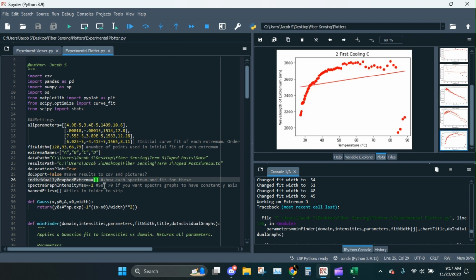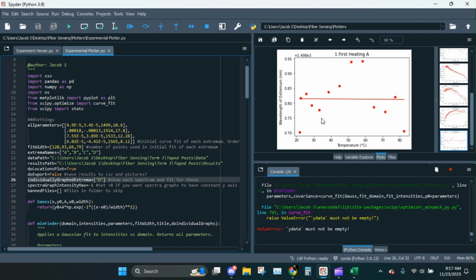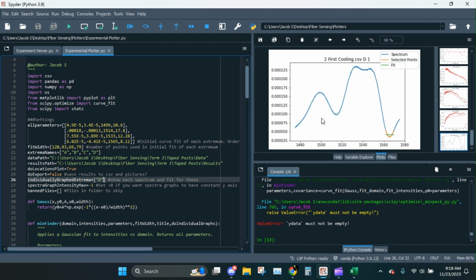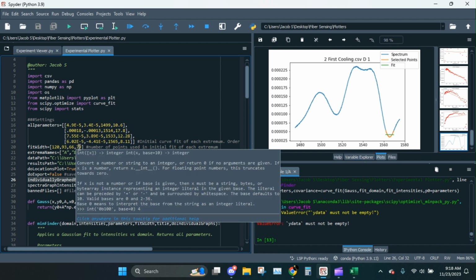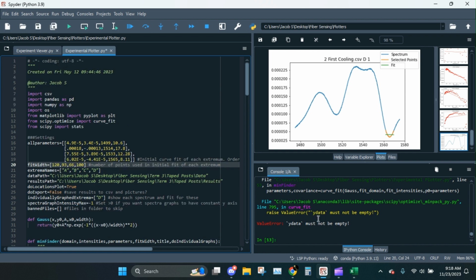Okay, so let's have it show us D. Go again. Yeah, again, it's not working. It's strange because that looks like a Gaussian, right? So first thing I'm gonna try is increase the number of points. So 100, and I noticed it was decreasing a lot for C. Oh, yeah, but C is a weird one. Okay, I'll leave C alone. Let's try that again.